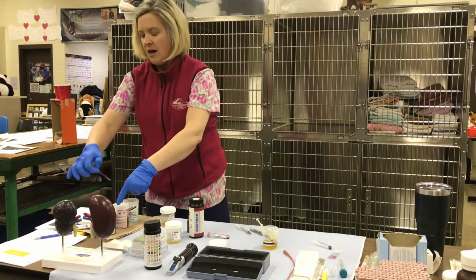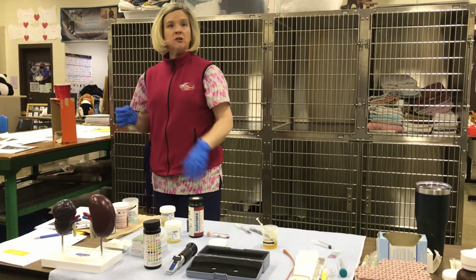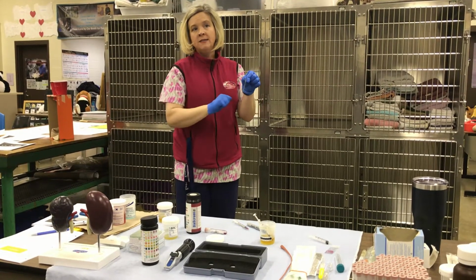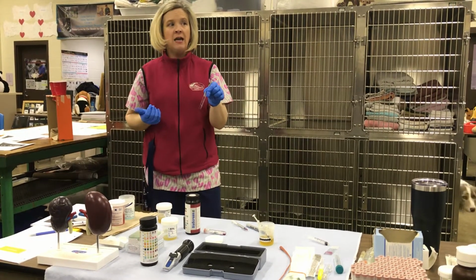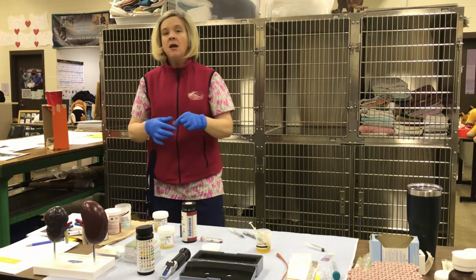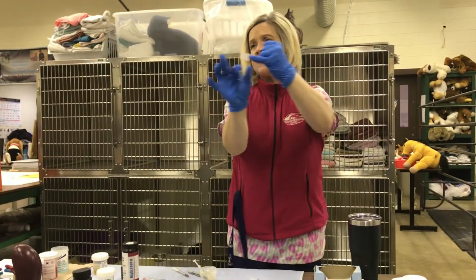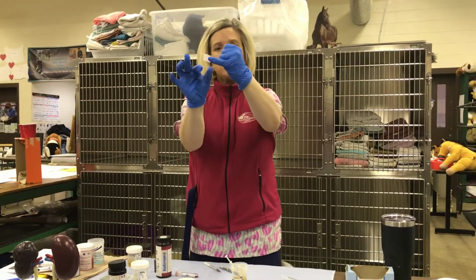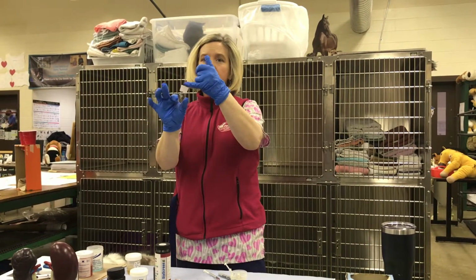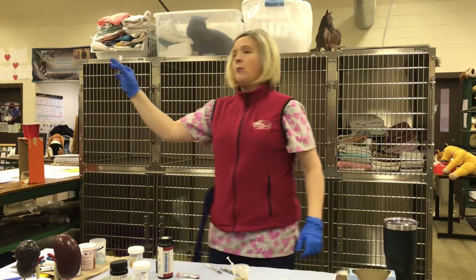So after you're done, it's done for 1 minute, you are going to go over and then you're going to actually run this under water, take a blow dryer, you're going to dry it, and then you would come to your technician and say, Mrs. Small, I've got your urine cytology prepared, okay? Another good habit to get into is to actually label the top. This is frosted, so use a pencil or a Sharpie, and you would write the patient's name on your actual slide, and then that way it's identified.